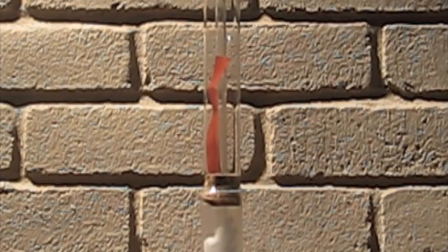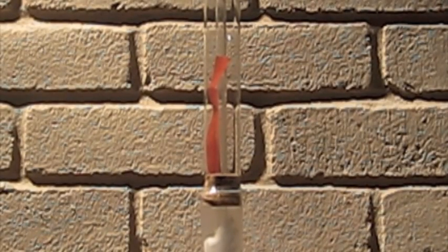Here you can see the red piece of litmus paper. After some time it will become blue.